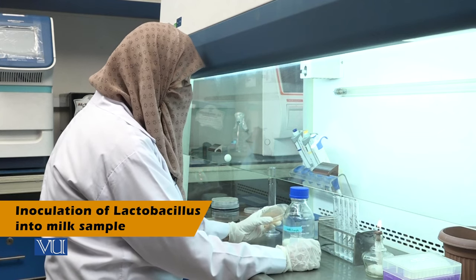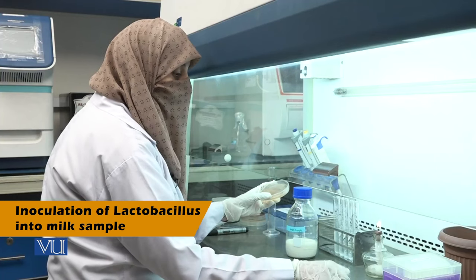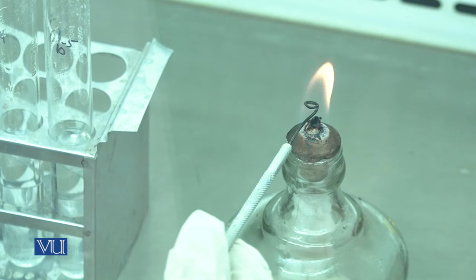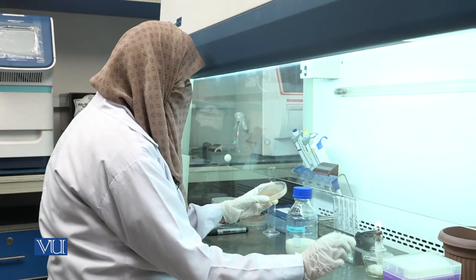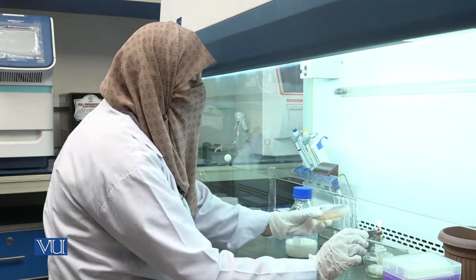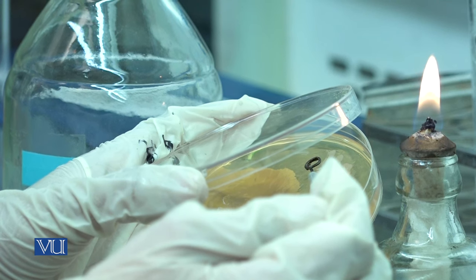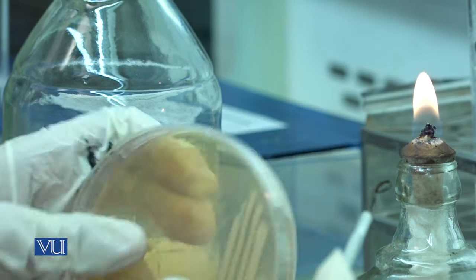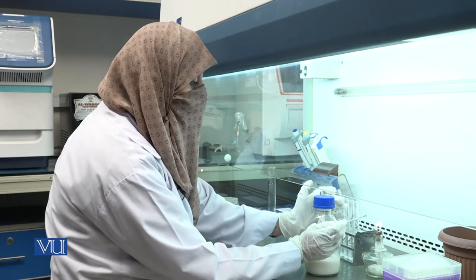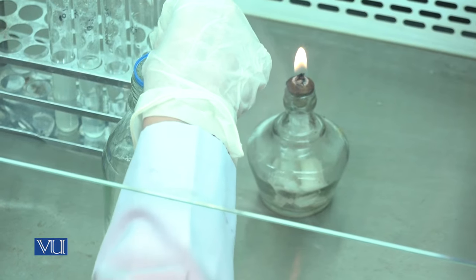This is the Lactobacillus strain, isolated and identified. Flame the inoculating loop to red hot and allow it to cool for one to two minutes. Now take a single colony of Lactobacillus and inoculate the milk sample with the help of the inoculating loop.